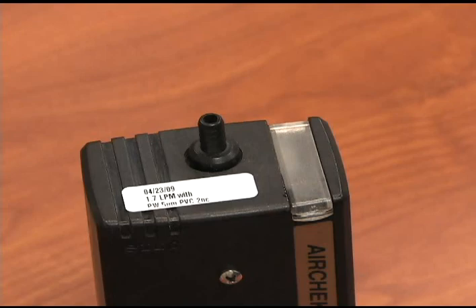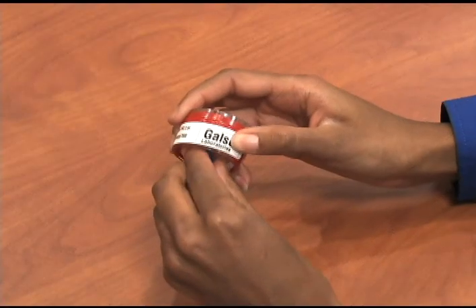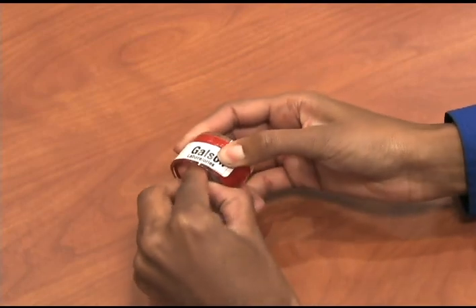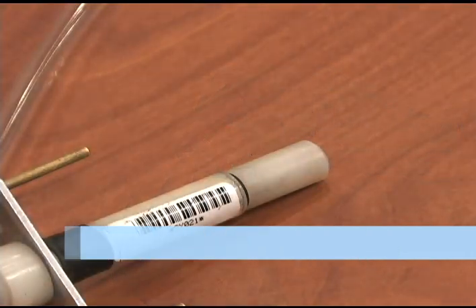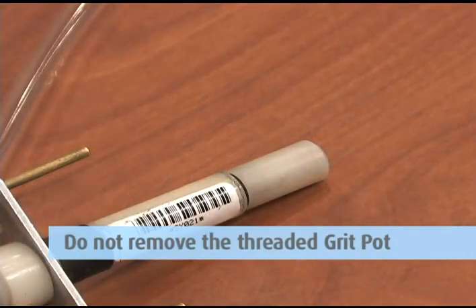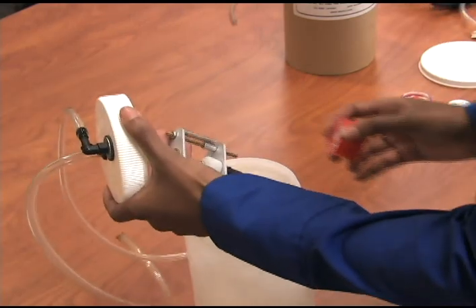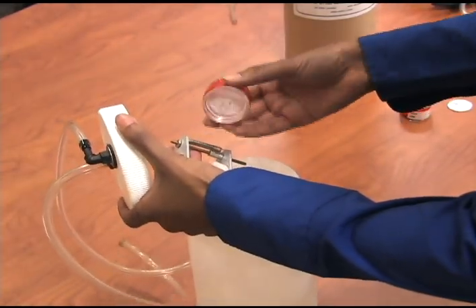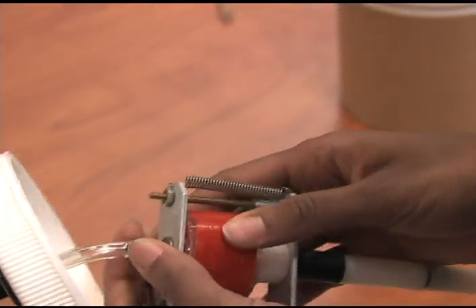All pumps have the lab calibration information on the pump calibration data sheets provided. To set up the cyclone assembly for calibration, remove the colored nibs from each end of the cassette. Do not remove the threaded grit pot on the bottom of the cyclone. Open the plastic calibration jar, insert a cassette into the bottom plate of the metal cyclone holder with the wagon wheel pattern up, then place the cassette in the cyclone by extending the springs of the metal holder.